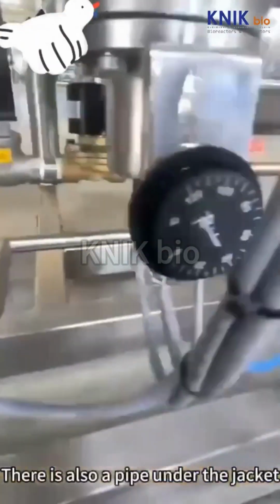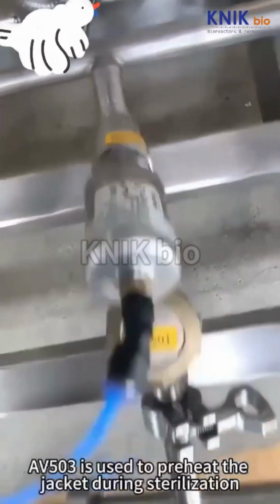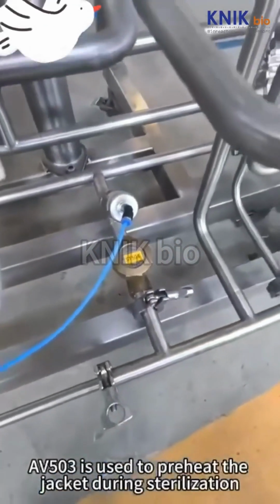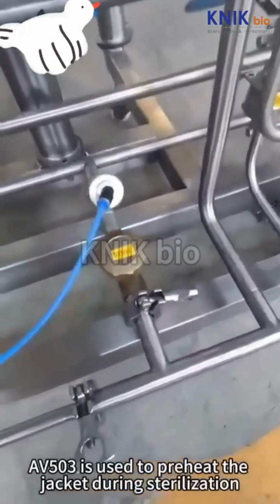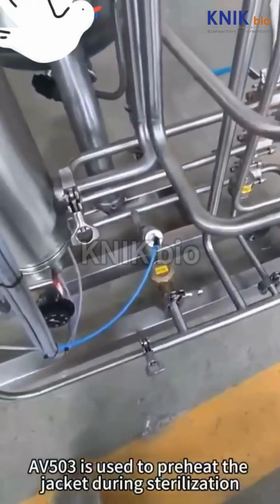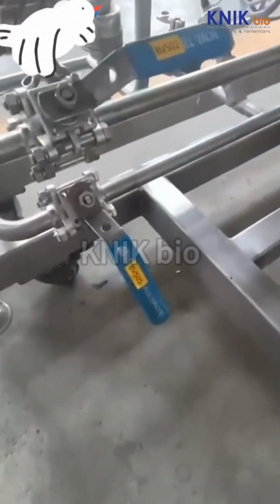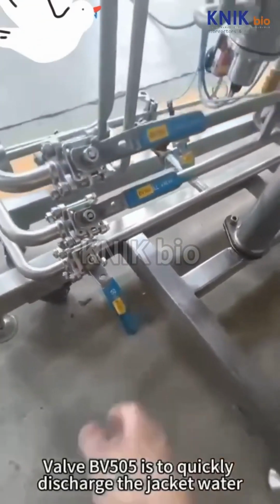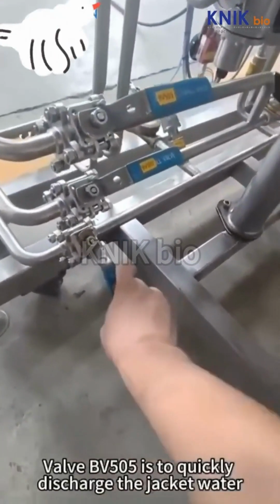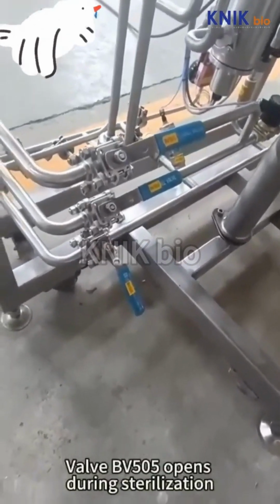There is also a pipe under the jacket. AV503 is used to preheat the jacket during sterilization. Valve BV505 is to quickly discharge the jacket water. Valve BV505 opens during sterilization.